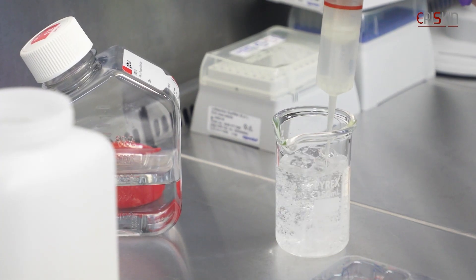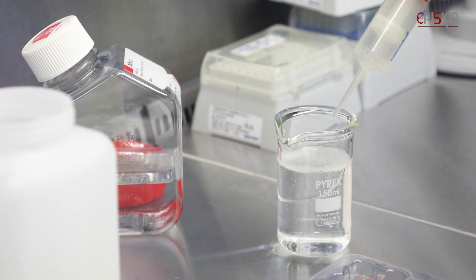After a defined contact time, the tissue is carefully rinsed with a physiological solution.